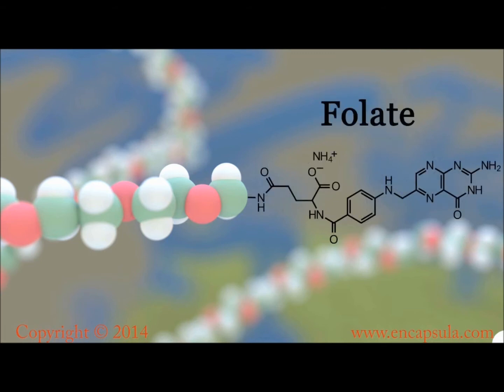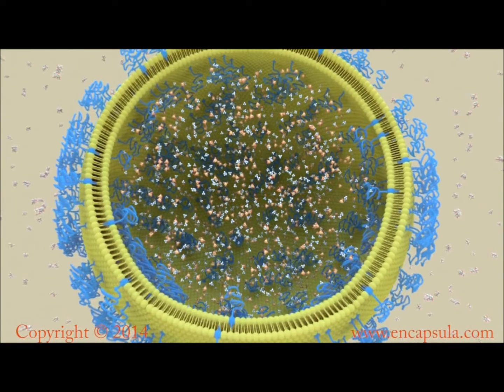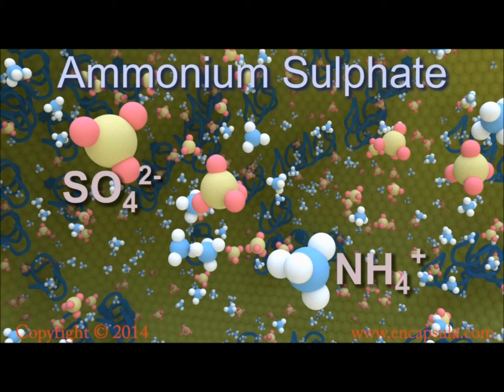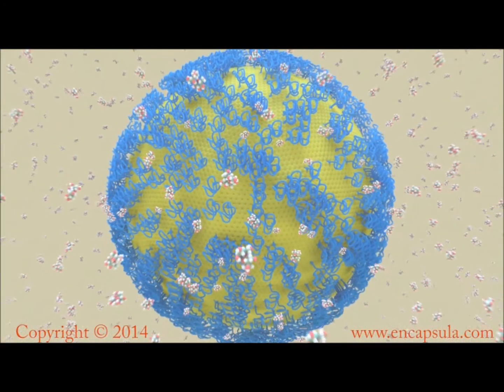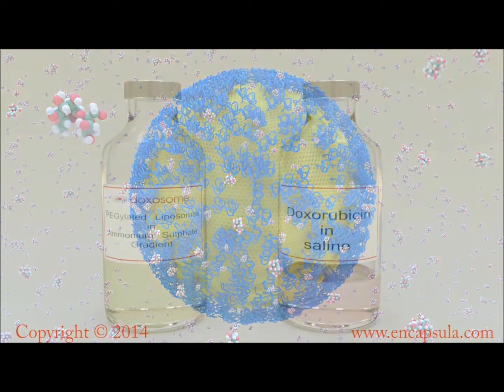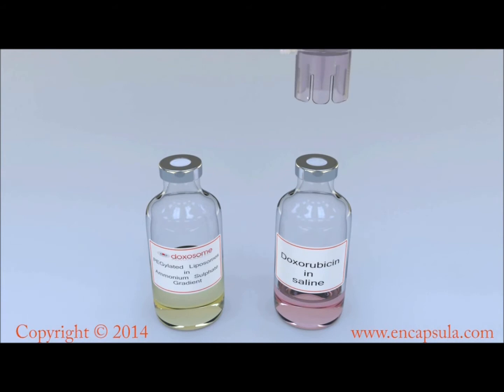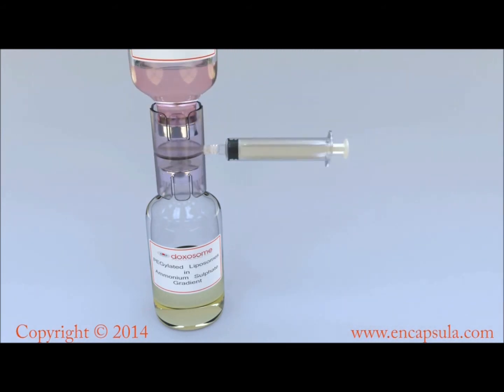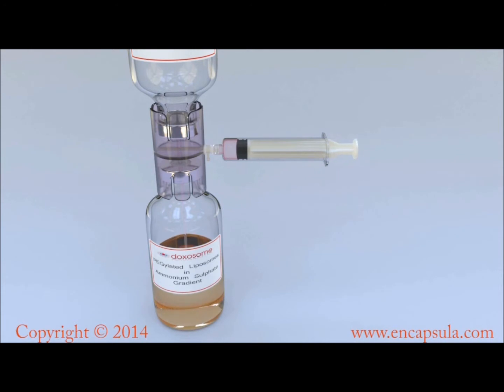Liposomes can also contain folate for targeting folate receptors. To enable remote loading and encapsulation of doxorubicin, an ammonium sulfate gradient must be created. Ammonium sulfate is encapsulated inside the liposomes, while outside the liposomes there is a 10% sucrose solution in histidine buffer. Pegylated doxorubicin liposomes are formulated by remote loading of doxorubicin into the plain pegylated liposomes containing an ammonium sulfate gradient.